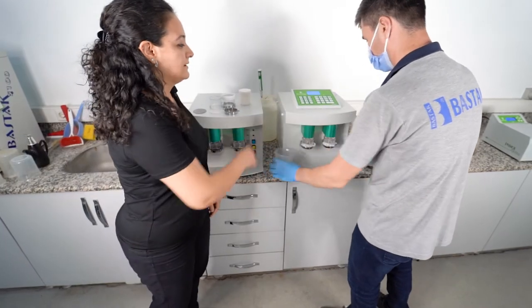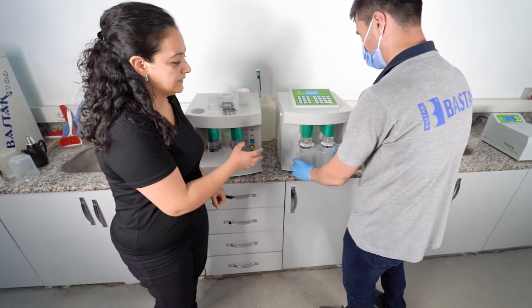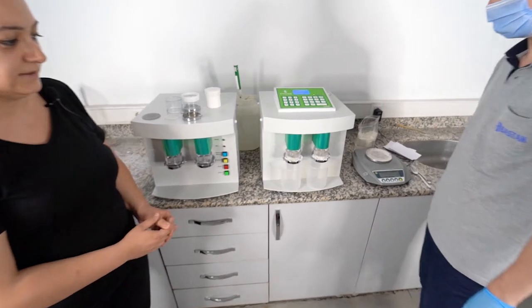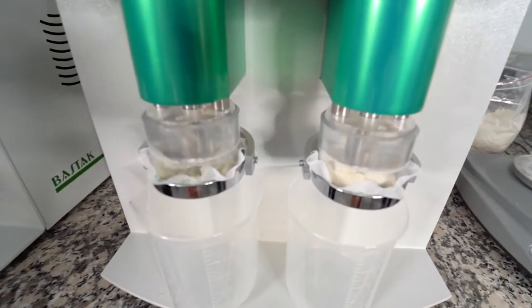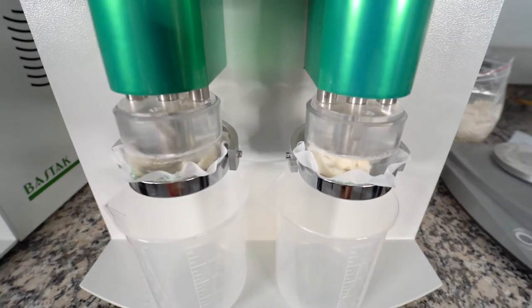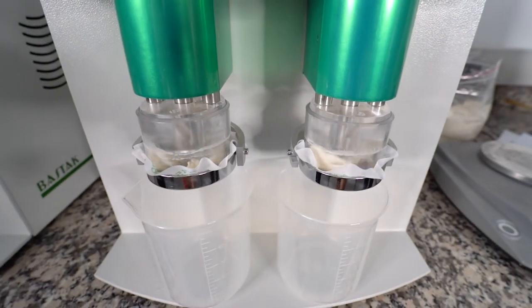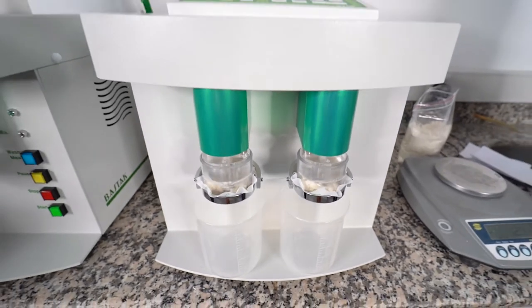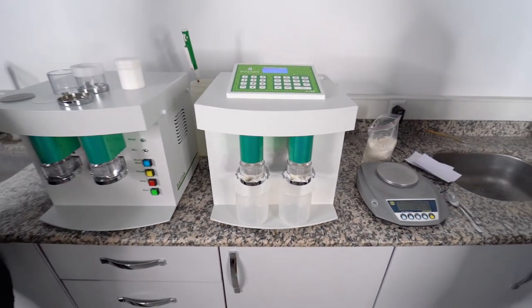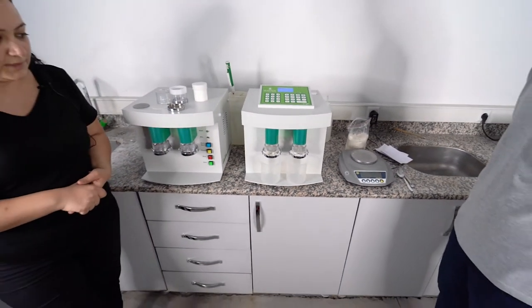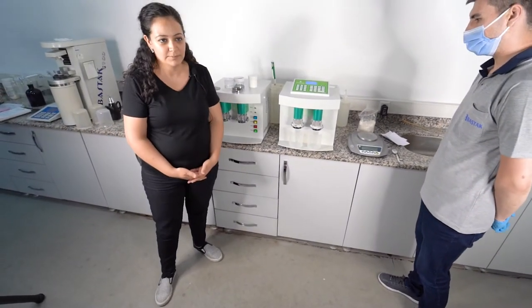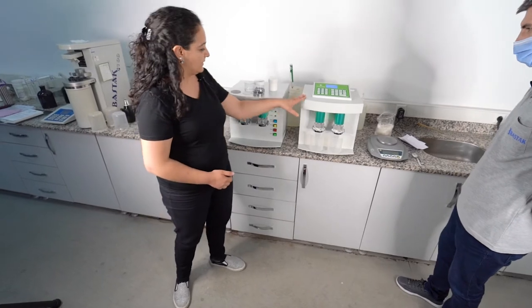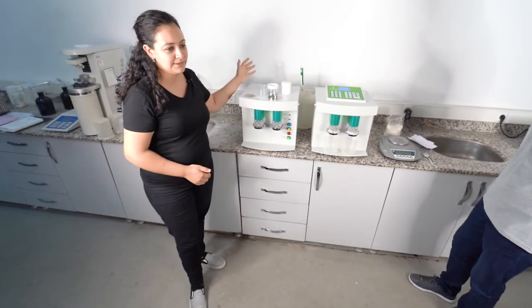Press start and the machine does the test automatically. 20 second mixing step now without water, and after 20 seconds it starts to take the water from the washing bowl automatically and wash 5 minutes. Depending on the country, these times can be changed. Depending on the sample, it can be changed on this machine, but this model doesn't have this ability.